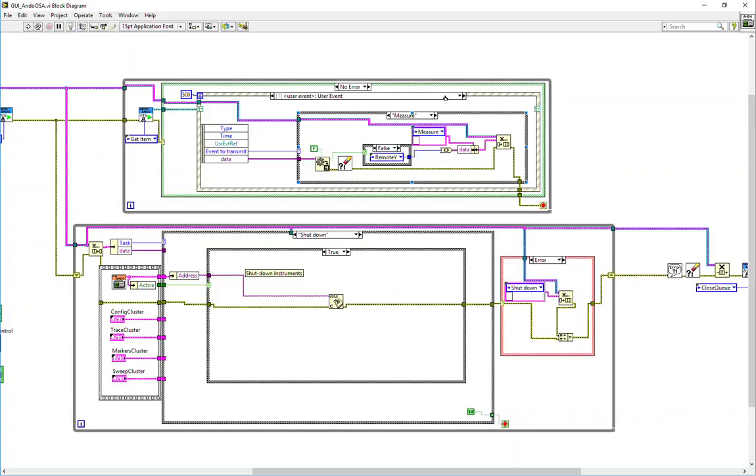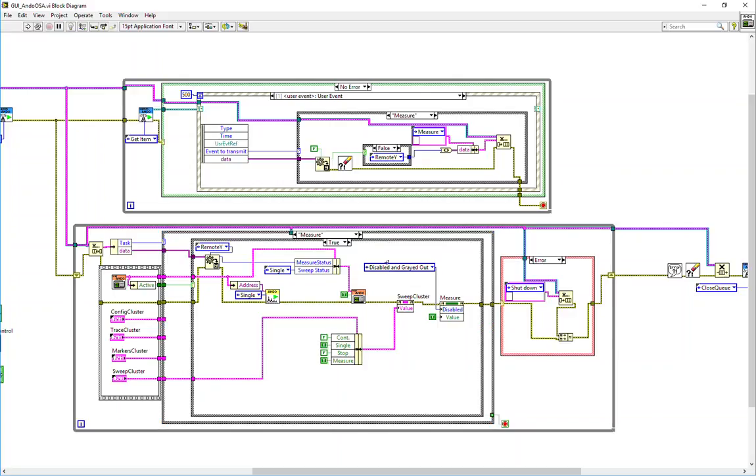Now, when the equipment GUI receives an order from the main VI to either measure, go to, or quit, it needs to execute its actual task relevant to its local choices. If it receives the order to measure, it will execute the measurement task, which will appear here. If it is ordered to quit, it will execute the shutdown task. If it is ordered to go to, in this specific case, it won't do much because this is a measurement VI, although some customization can be done in case the user actually does send a go to signal. In this case, it has been set to change the center value of the scan.